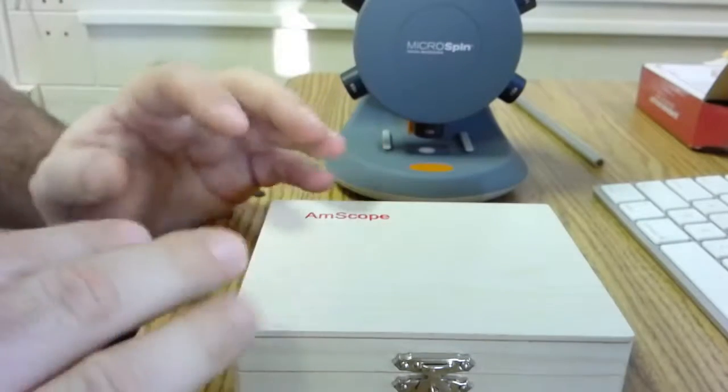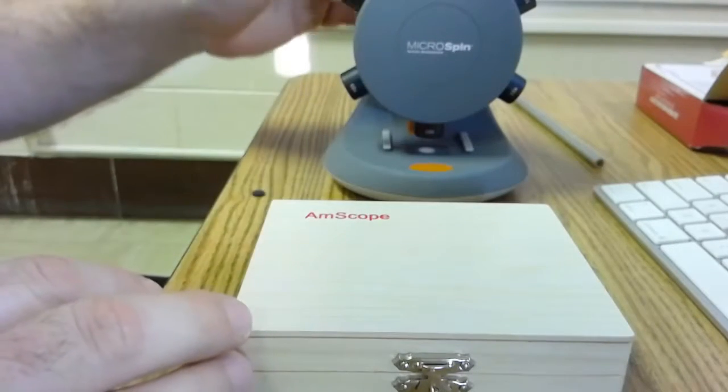Okay, so in this video we're going to see how to load slides into our microscope.